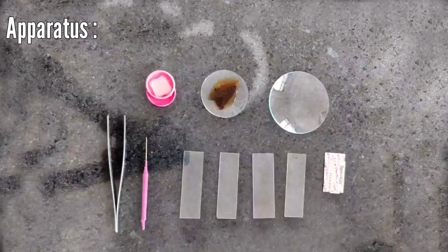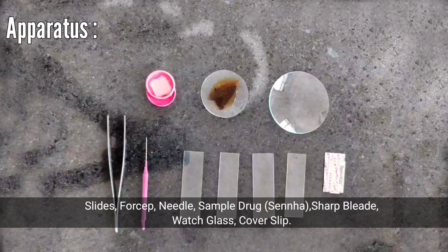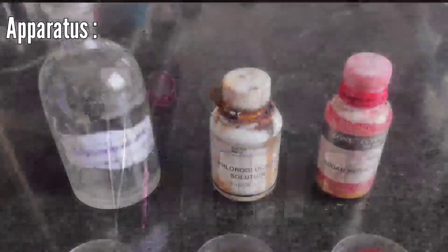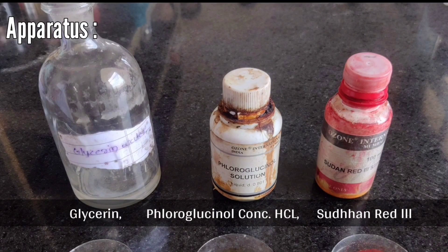Microscopy apparatus: slides, forceps, needle, sample drug, sharp blade, watch glass, and cover slip. Chemicals required are glycerine, water, phloroglucinol with concentrated HCl, and Sudan Red 3.